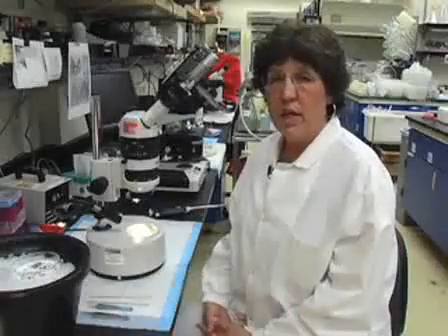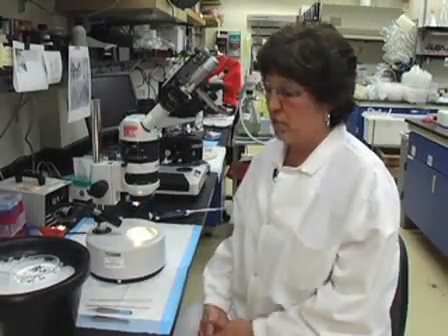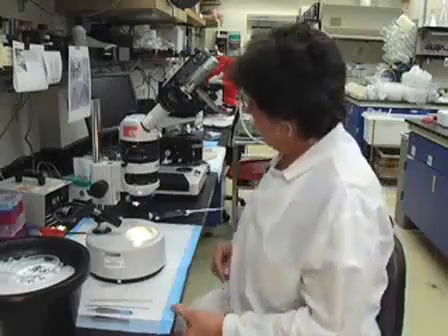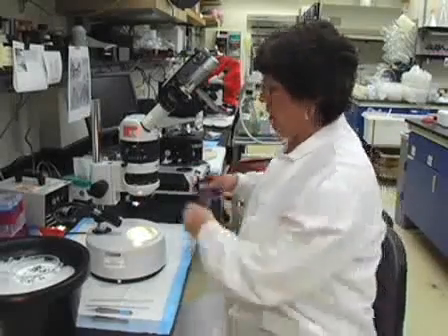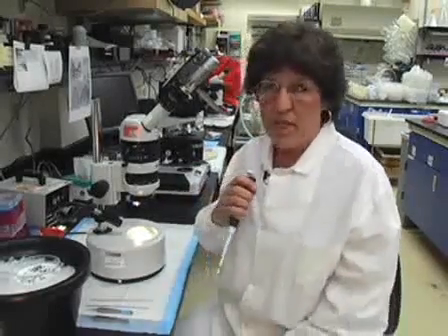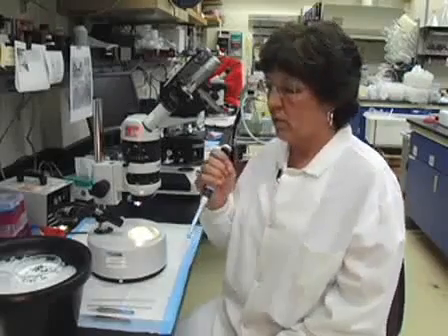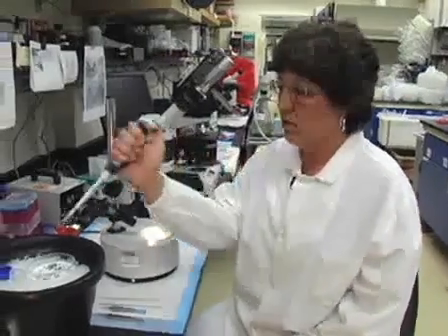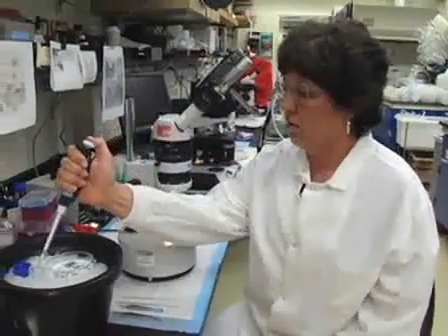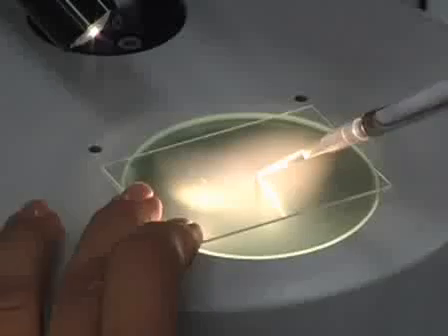What I'm going to be doing now is dissecting the midgut from the Aedes aegypti. First, I need to add 1x PBS — this is a buffer that maintains good physiological conditions. So we put it on the slide.